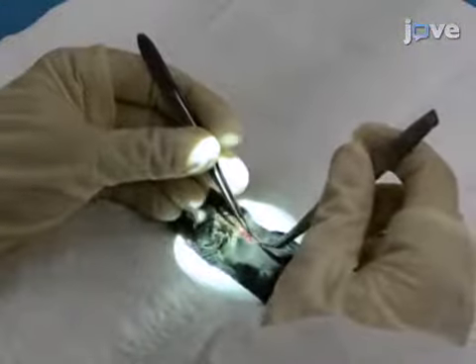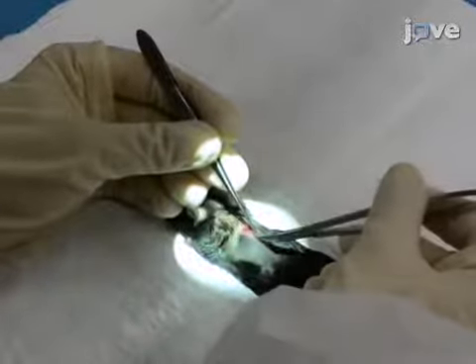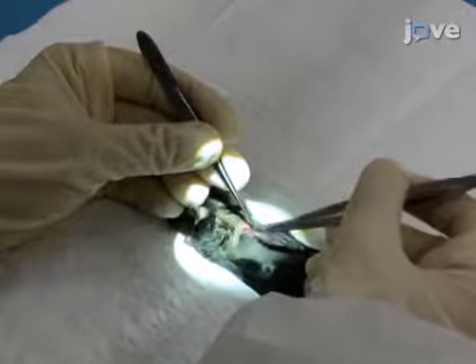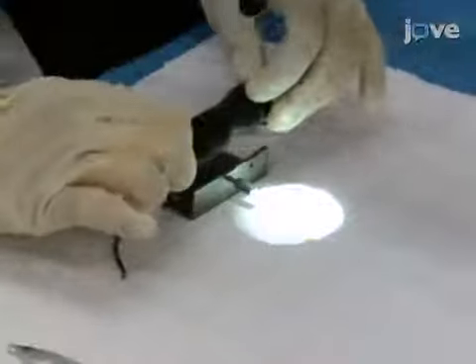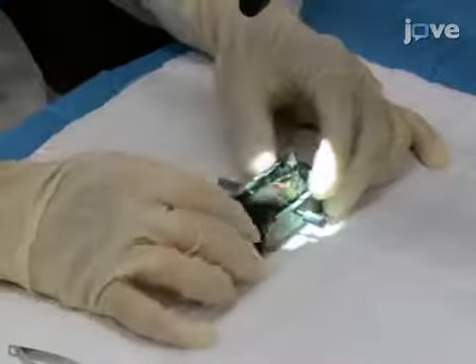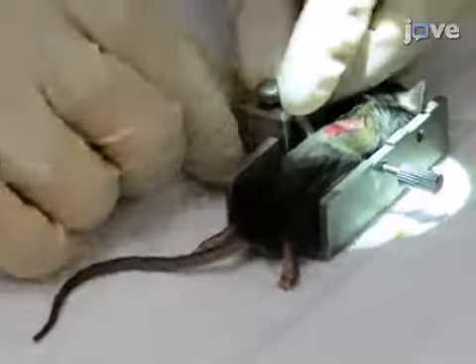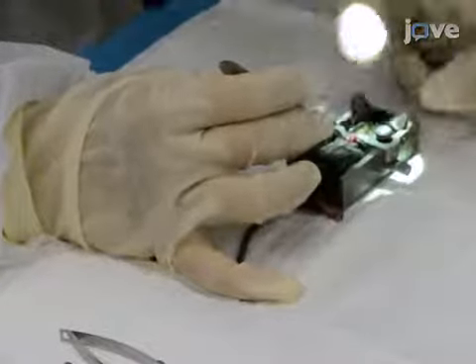Using fine scissors, fine forceps, and an Agricola retractor, dissect the paraspinal muscles away from spinous processes and laminae toward the lateral facets on each side. Position the mouse on the U-shaped container of the stabilizer. Clamp the stainless steel arms beneath the exposed facets of the T10 vertebra bilaterally, and tighten the arms with the thumb screws attached to them.